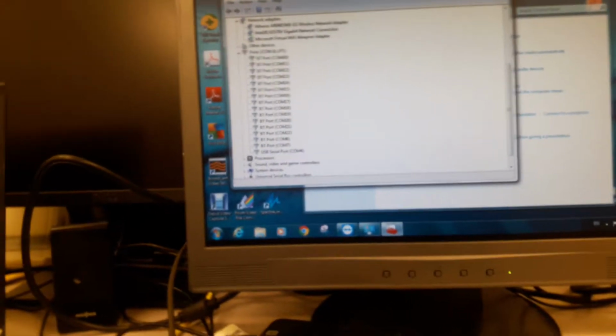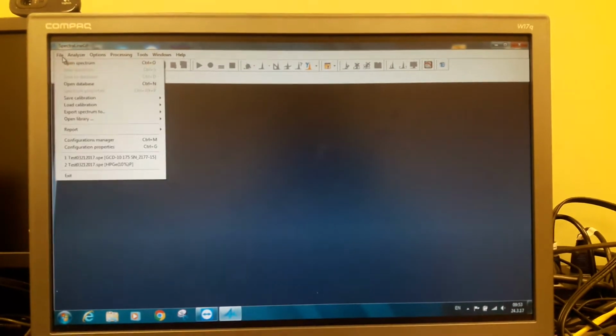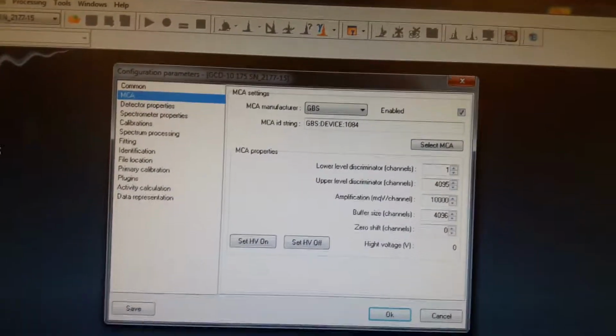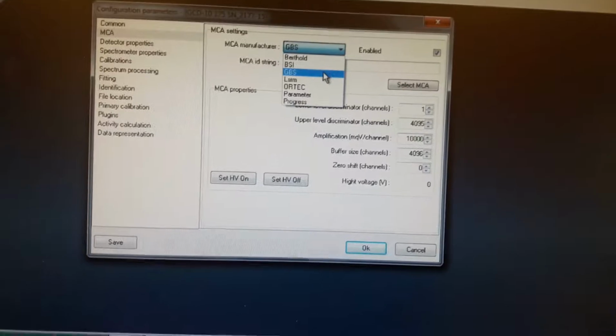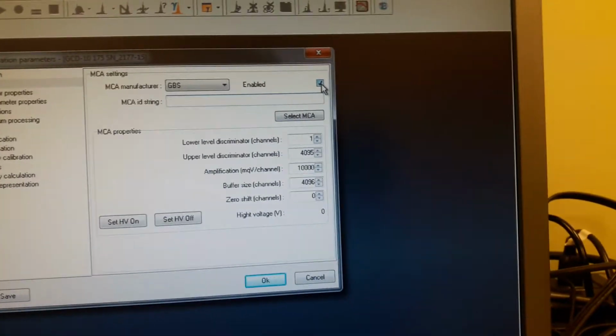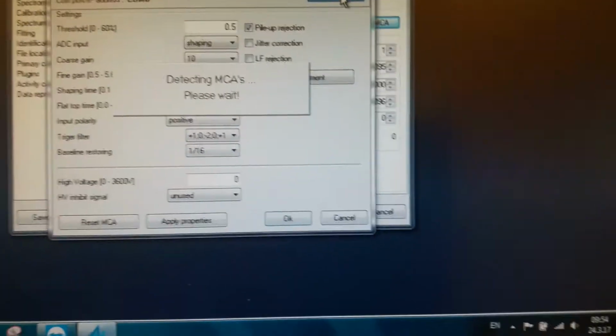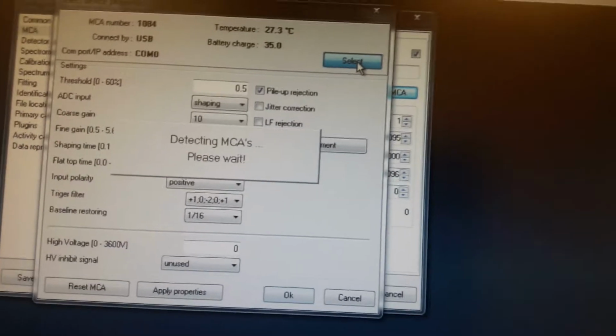Now we will go to the SpectraLine GP software and try to discover the MCA. And we will demonstrate to you, hopefully, that the MCA will not be found because we've turned it on before. So the typical procedure for discovering the MCA, if you have set up your configuration file for the detector already, is to go into configuration properties and go into the MCA. Select the manufacturer of the MCA, which is GBS. Make sure there is nothing in the MCA ID string. Make sure it's enabled here, and then we select the MCA. And we select again, because it's reading what was the last selected MCA.